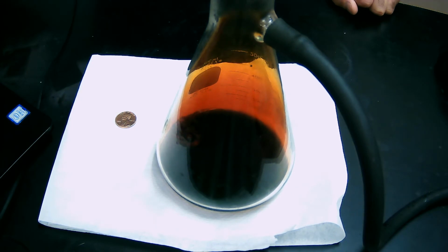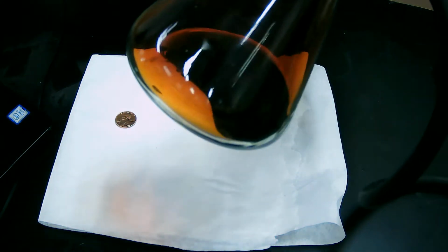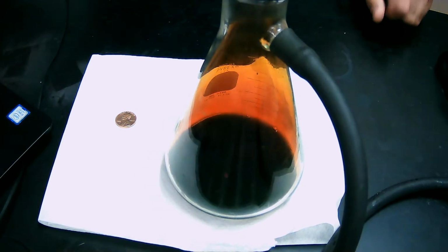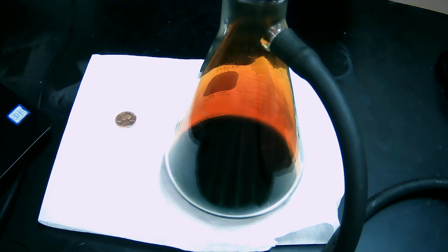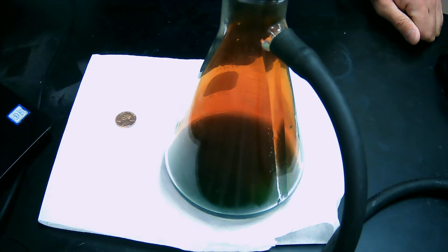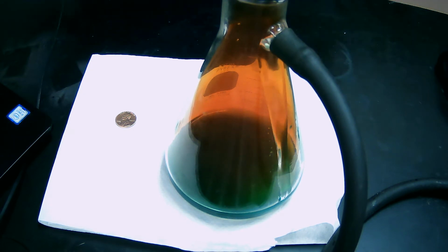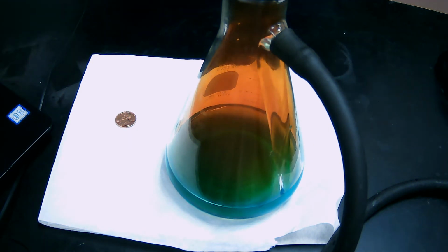So he did the first thing that came to mind, which was grab the copper penny and the mess and scoop it in his hands and toss it out the window. Not my first choice, but what he then learned was nitric acid not only acts upon pennies and basically makes them go away, there's no penny left in here anymore, but that it also acts upon hands. So his fingers were being basically burned with the acid, and in response to that, he wiped them on his pants and learned that nitric acid also acts upon trousers. So he's hacking and coughing and very likely eyes watering. His hands are burned with acid and his pants are ruined. They've probably got some big holes in them.